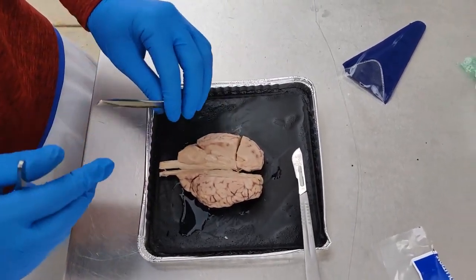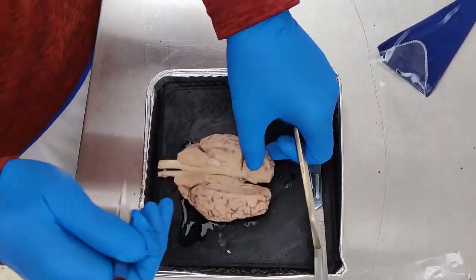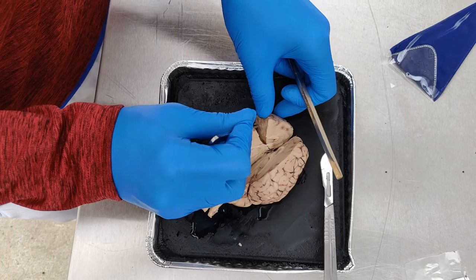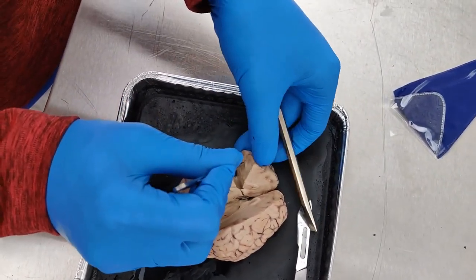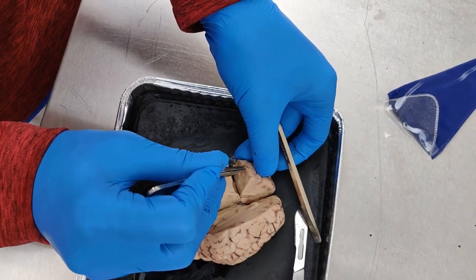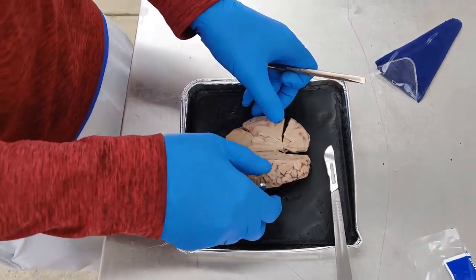And then the white matter and gray matter. The white matter would be right here. I'm going to angle this better. Right here. You can obviously see the white matter. And the outer gray matter would be up above that, right over here. And I believe that's everything that I need to do. So we're good.